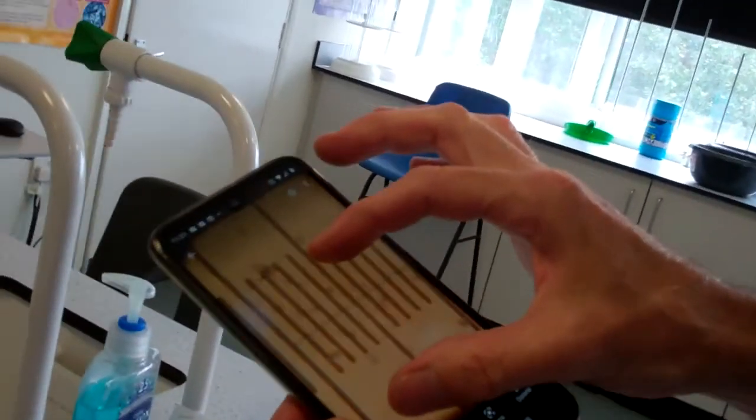Make that a little bit bigger. The large lines are the stage micrometer. The small lines going from 0 to 10 is the eyepiece graticule. If you look, there are 10 stage micrometer divisions matching up with 100 of the eyepiece graticule. Let's go again to the board.